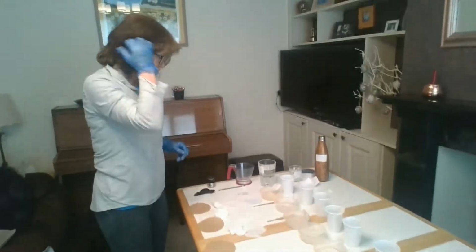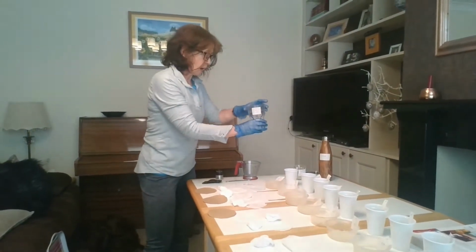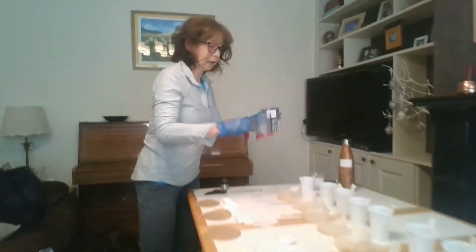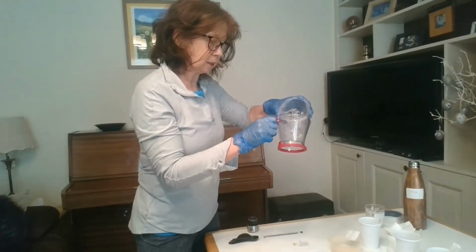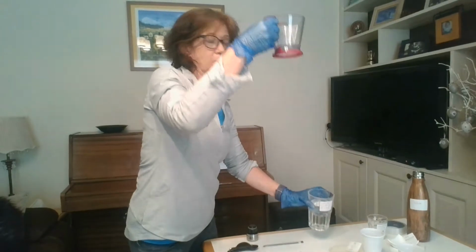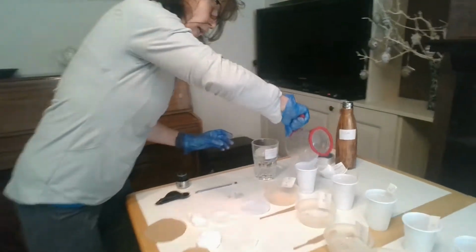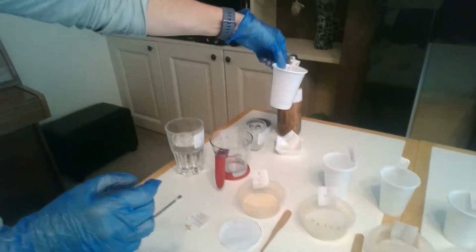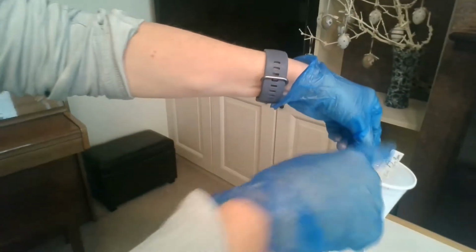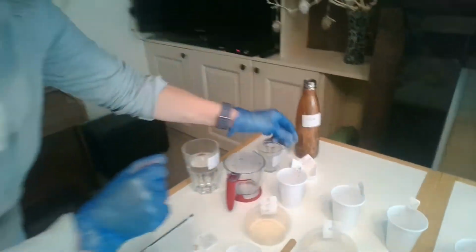Okay, so how do we set up the experiment? You get your stock solution, and again, you're going to have to use a graduated cylinder, and you're going to put 10 mils, as best as I can measure, 10 mils of IAA solution into your first bottle. So that's bottle A with 10 mils of your IAA solution. Now I'm going to start my serial dilution.